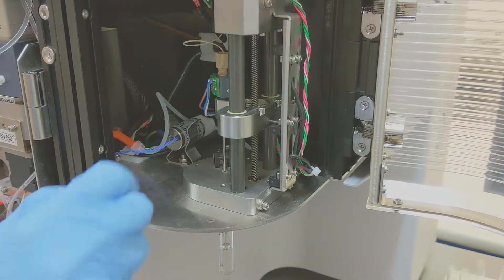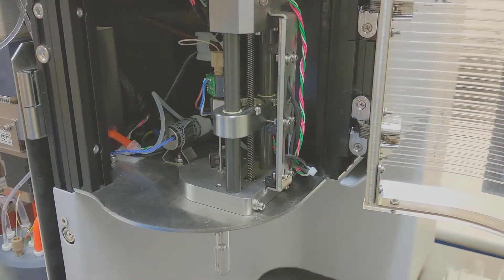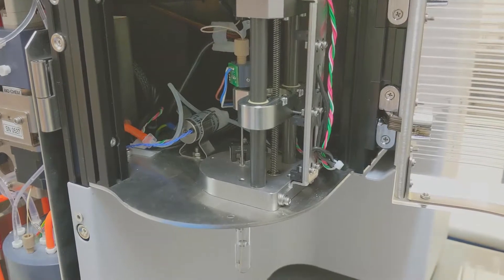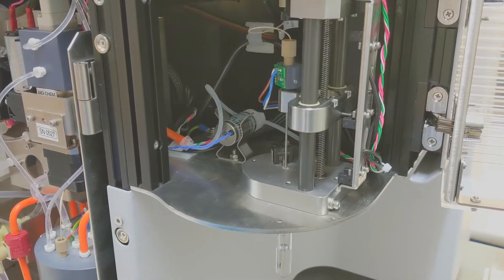Okay, there's one screw. Don't lose the washer that goes with it. I'm going to set that aside and go back for the second screw.